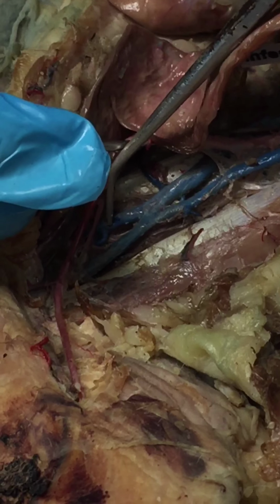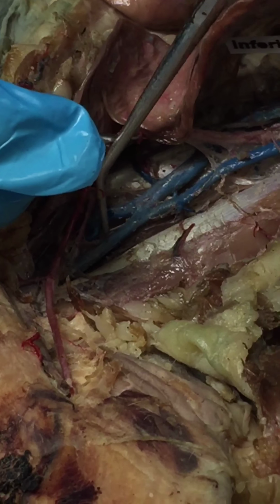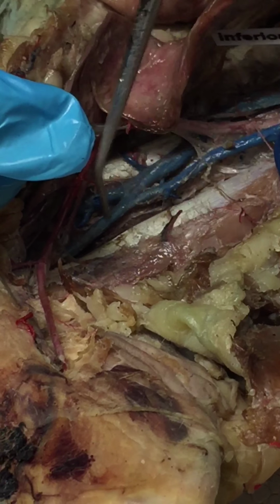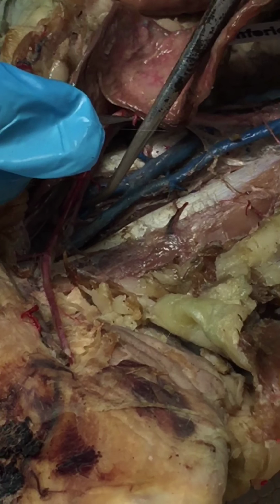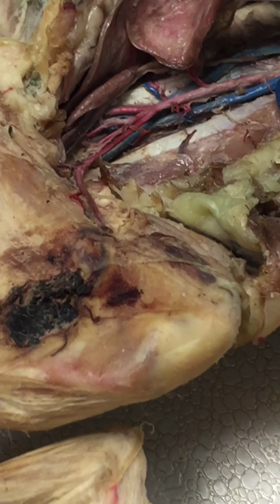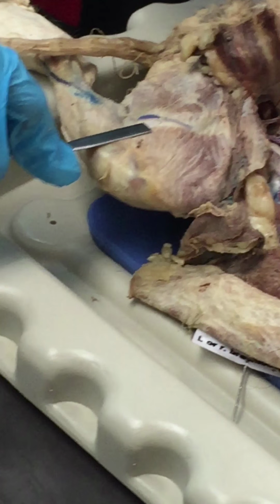So everything above the internal iliac, that'd be the right internal iliac. Everything above the right internal iliac would be the right common iliac. Everything beneath that would be the right external iliac. Okay? And then the femoral is out here. Same, and you can really see the femoral here. Femoral. Okay? Same place, it'd be right here.